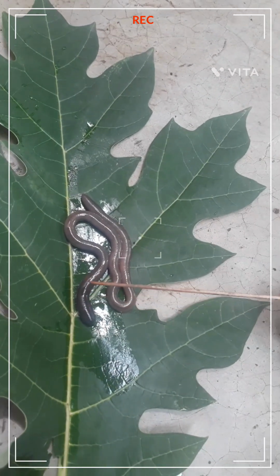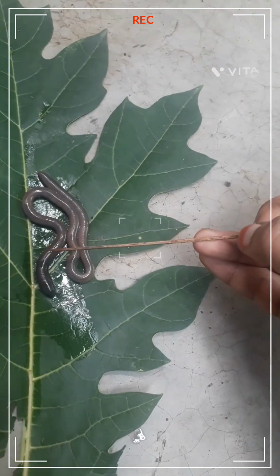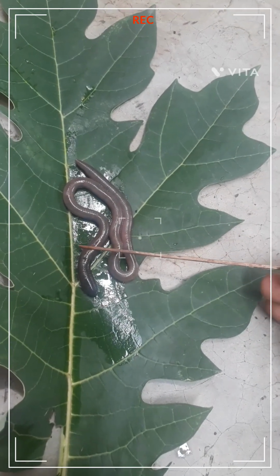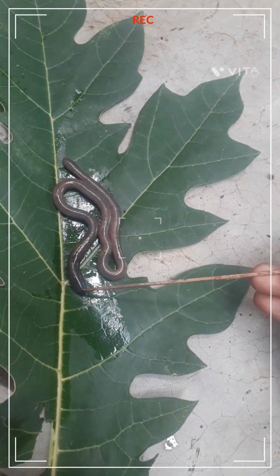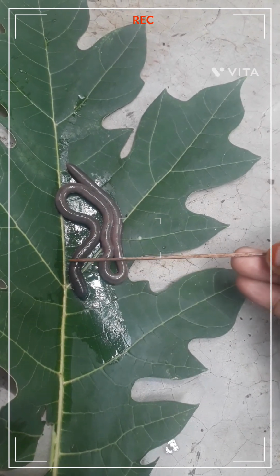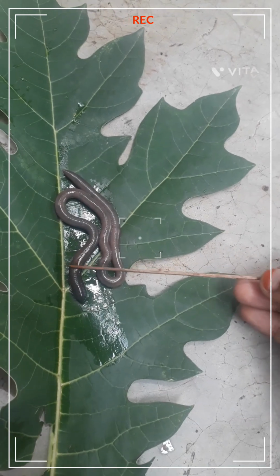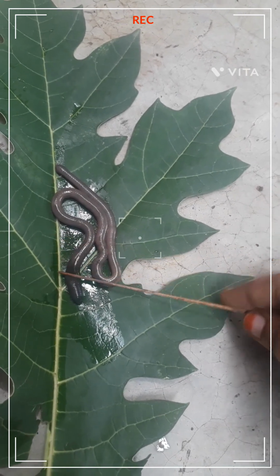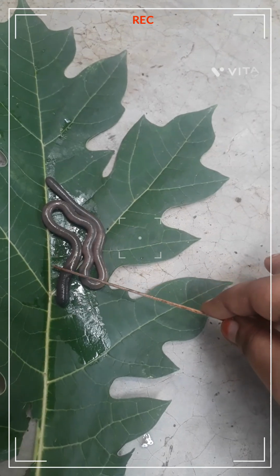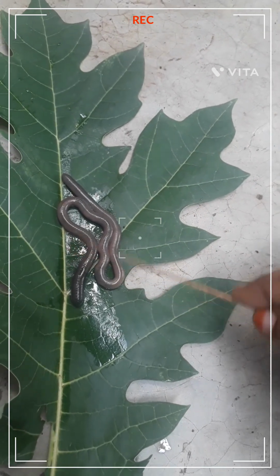Prostomium, peristomium, and where the dark color ends, it has the spermathecal pores. The segments start from here, 1 2 3 4 5 6 up to the ninth. In the ninth segment, the spermathecal pores are present. Up to this region is called the anterior part of the earthworm.